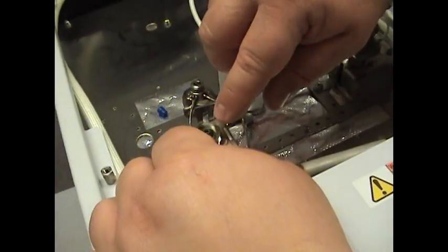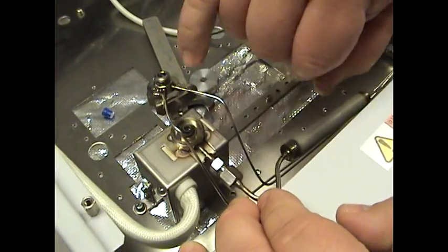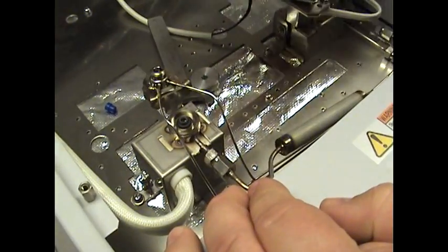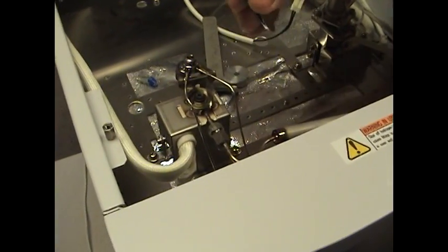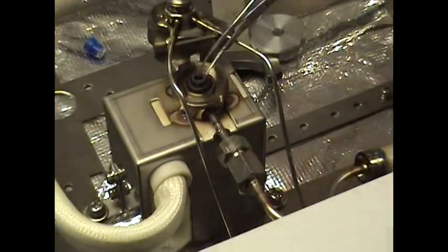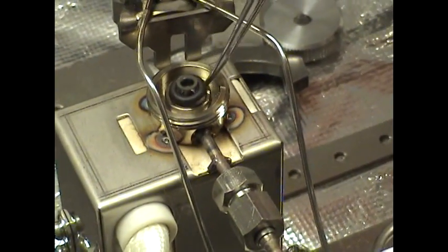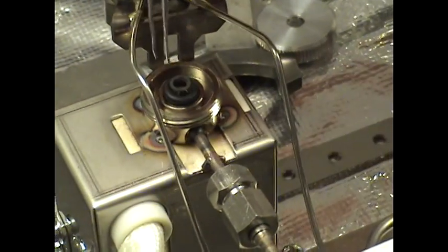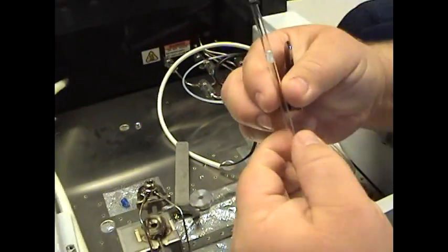If you have a system that's been used for any length of time, this O-ring will be deformed and will be pretty much heat-sinked to the injection port itself. You'll want to get a pair of tweezers to pull that out. Take your tweezers and gently pry it around the liner. It's very important not to scratch the lined surface of this injection port. Once you loosen up that O-ring, the liner should come out fairly easily. Pull that up and that is the glass liner.